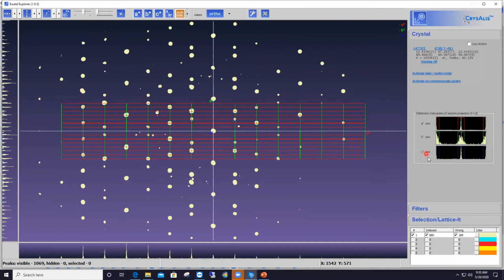You see also on the intensity histogram along B star that we have wide, badly shaped reflections at the lattice points, suggesting again that part of the indexing doesn't seem totally right. So this is the reason why CrysAlisPro gets confused here: we have a non-merohedral twin dataset. And the game for me now will be to rotate around that diffraction pattern again until I've got an orientation that shows intertwined rows of reflections.